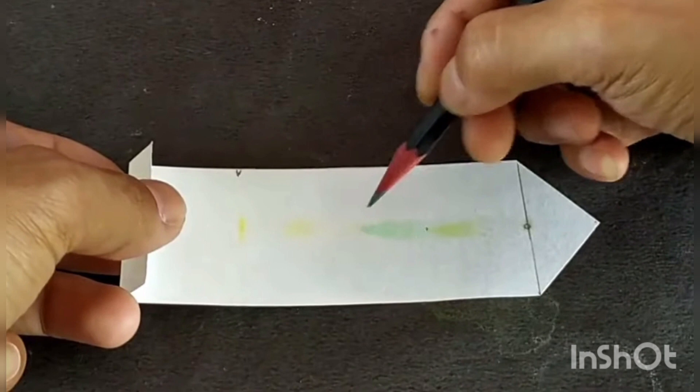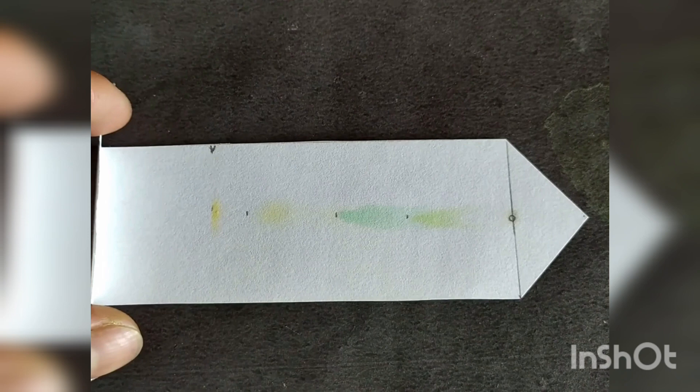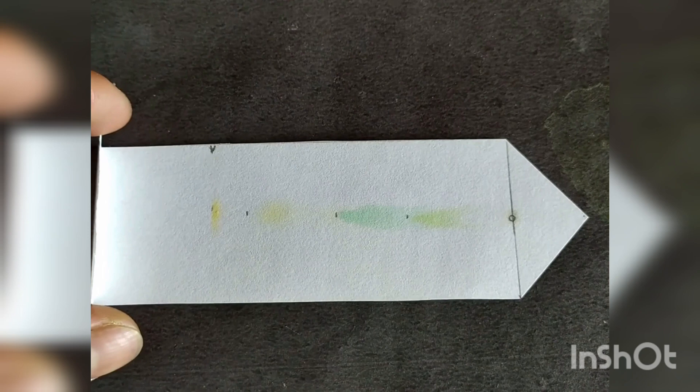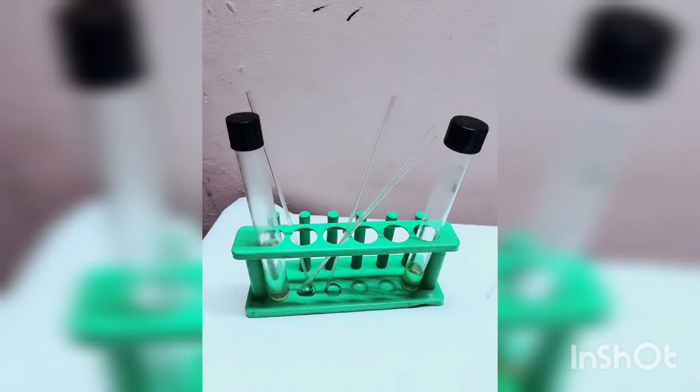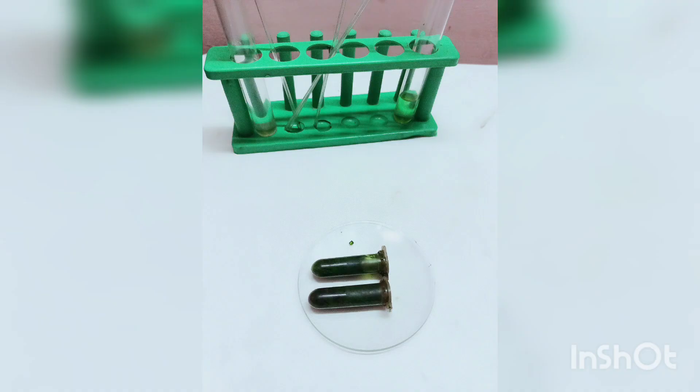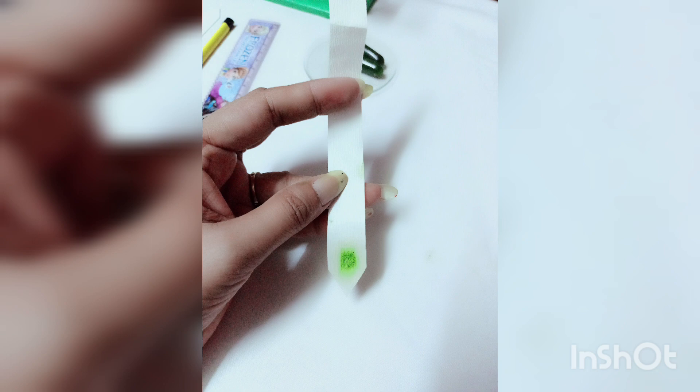You will see light green, dark green, and yellow colors. After that, you have to measure the distance traveled by the solvent and the distance traveled by different pigments — dark green indicating chlorophyll a, light green indicating chlorophyll b, and yellow indicating xanthophyll. Here is the setup of paper chromatography with the test tube stand, a china dish, extract in eppendorf bottles, and a strip. After loading your extract, you put the strip in the test tube to find out the result.